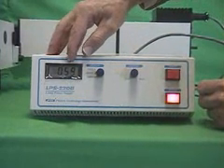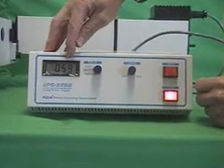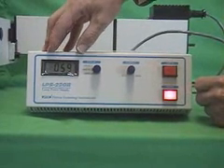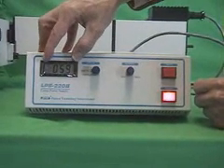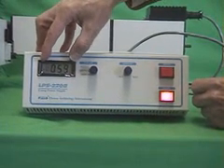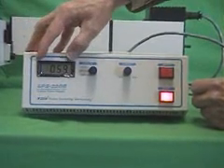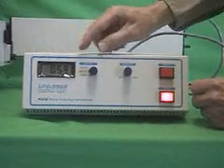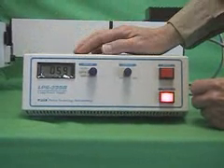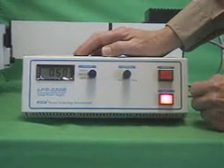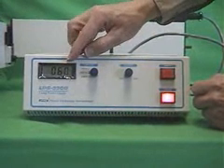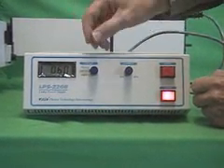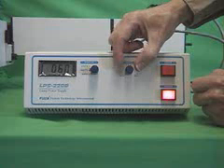In ignition you will hear a faint click from the lamp, and you will also notice a large fluctuation in the display. It will shoot up to over 100 watts for a moment and then settle down back to its normal operating range. Once you've got that it takes about 10 to 15 minutes for the lamp to warm up to its operating range. Even after 5 minutes, even after a couple of minutes you can start increasing the current or adjusting the current.